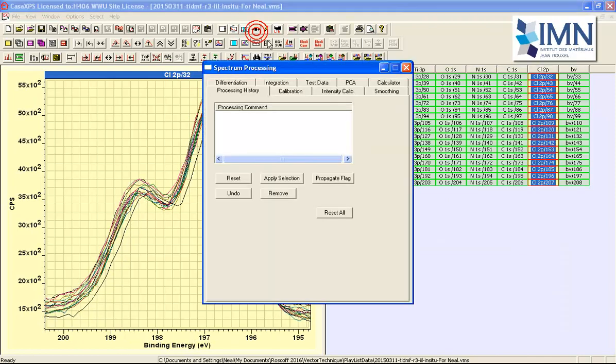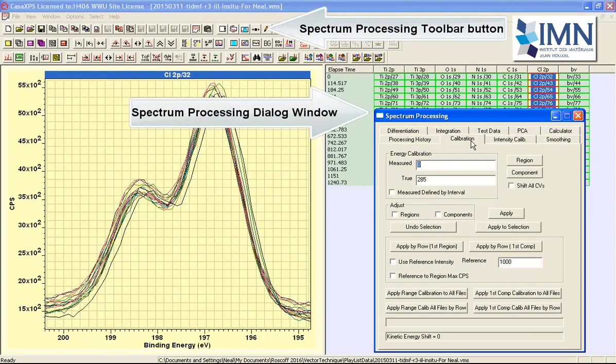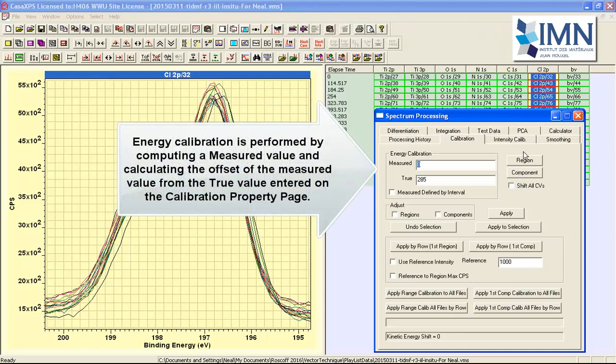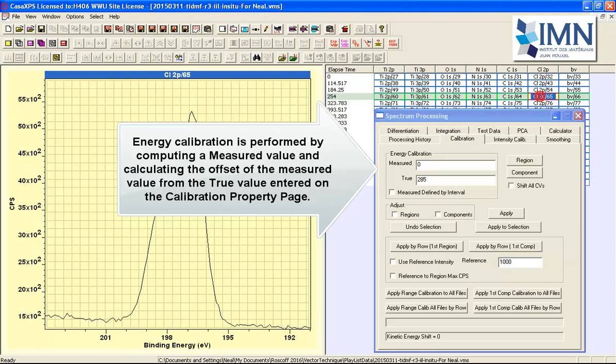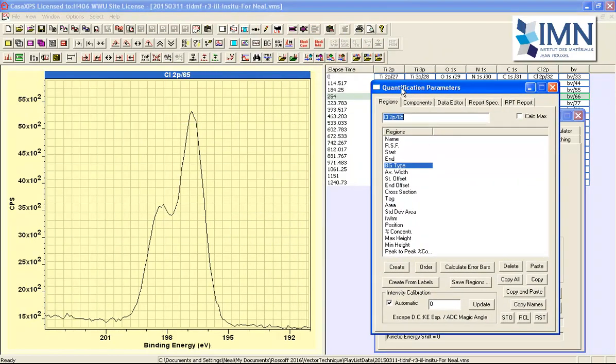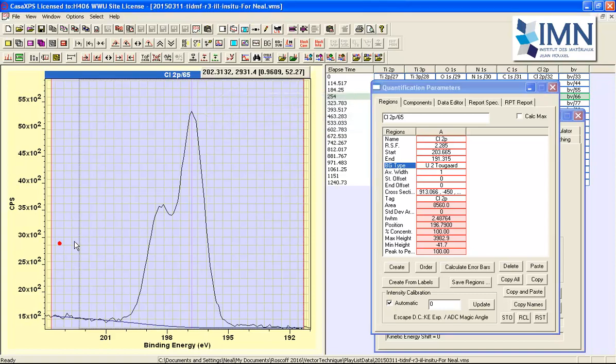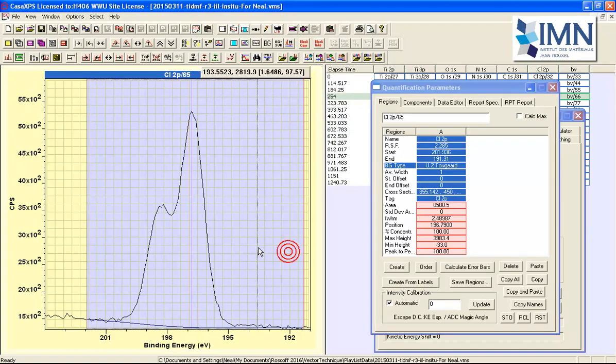The processing option that we're going to use to calibrate these data is on the calibration property page of the spectrum processing dialog window, and it's the apply by row first component. So what we must do is create a peak model for one of these data. So we'll use the quantification parameters dialog window, and the first property page is the regions property page, and this allows us to define a background. So we'll define a background and just make a minor adjustment to the limits.